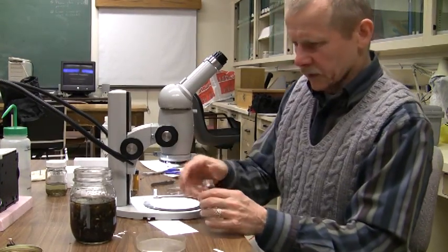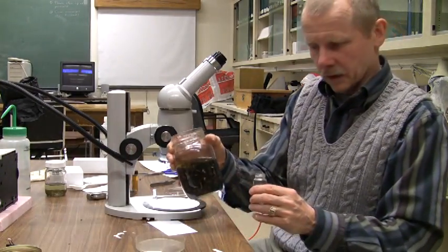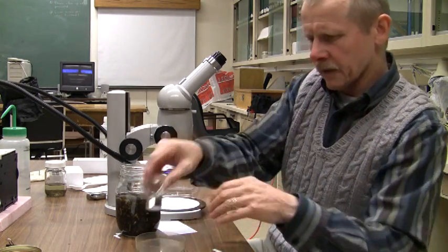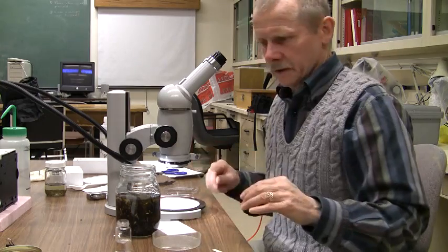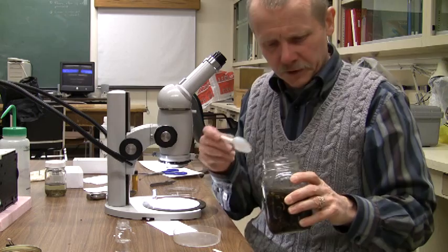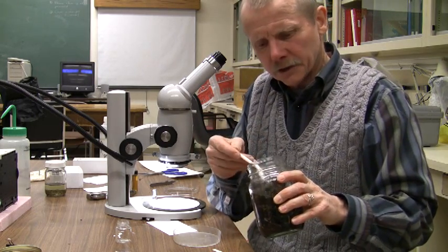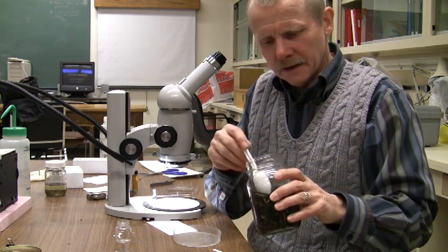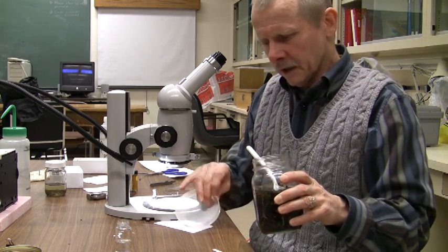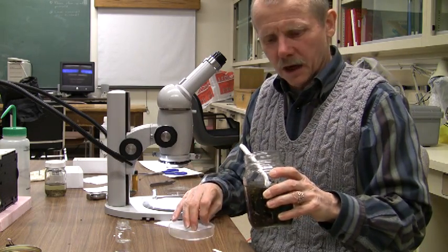This will then be where you can store the ones for subsequent mounting. There's lots of material for most of these to go around, and we want to sort this in a consistent manner. The easiest way to start sorting is to just take a small amount of the sample and put it into one of your petri dishes. It really is much better to use a small amount — if you have too much stuff in the petri dish, you simply can't see what you've got.